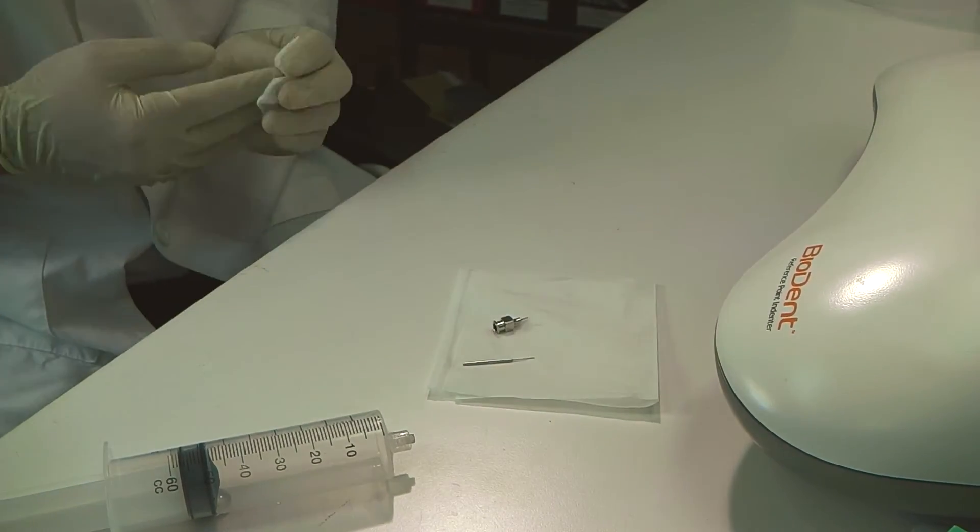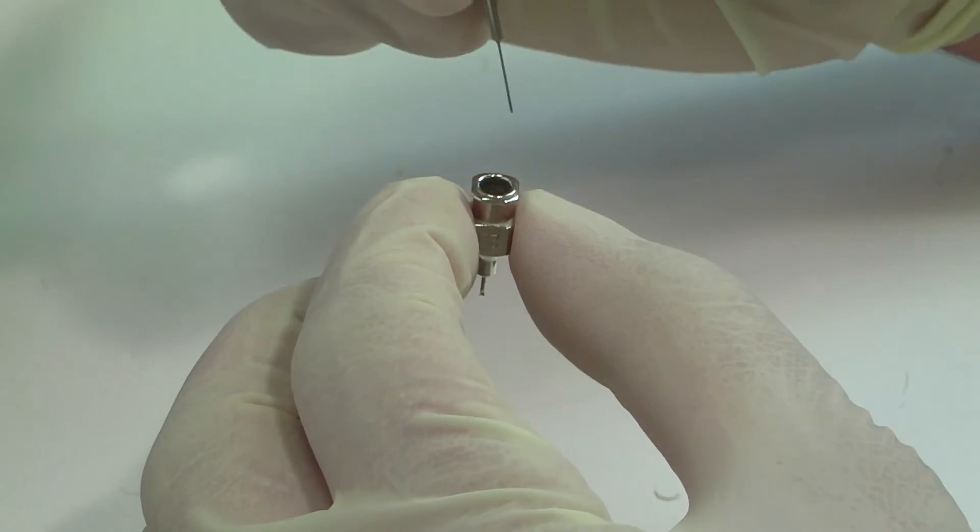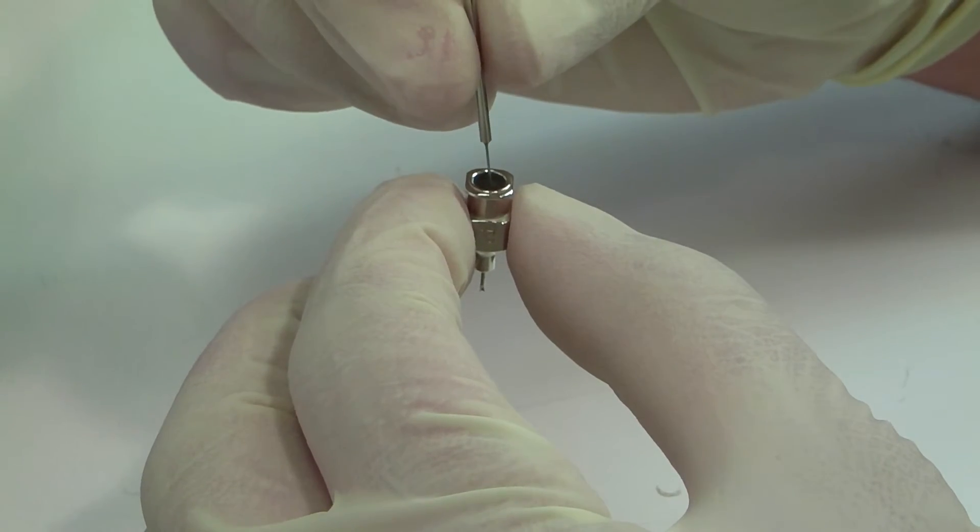To recouple the probe assembly, carefully bring the tip of the test probe as close to the bottom of the inside of the reference probe as possible.